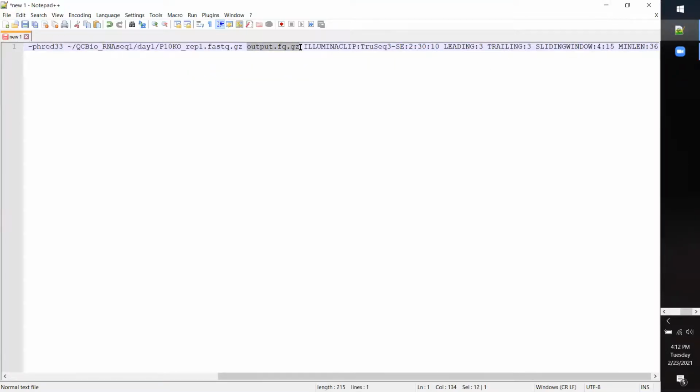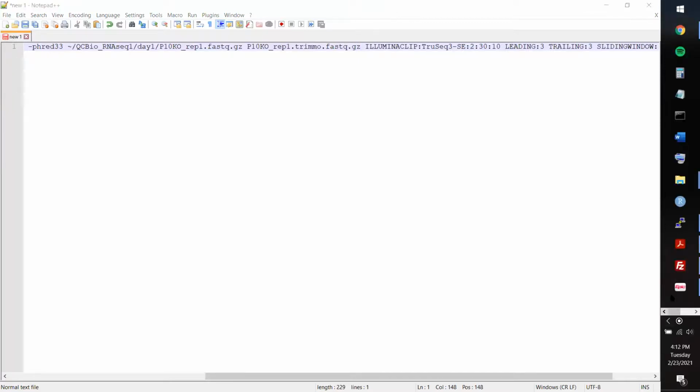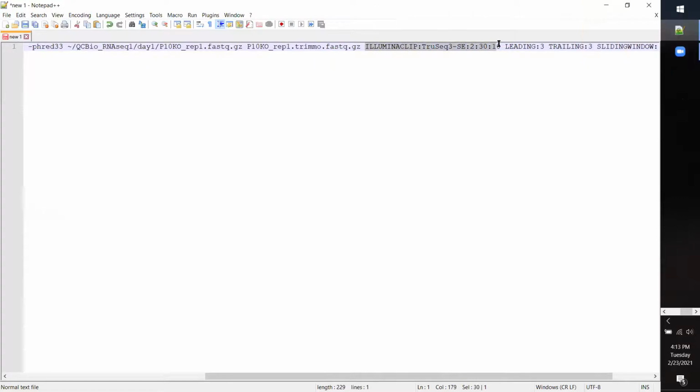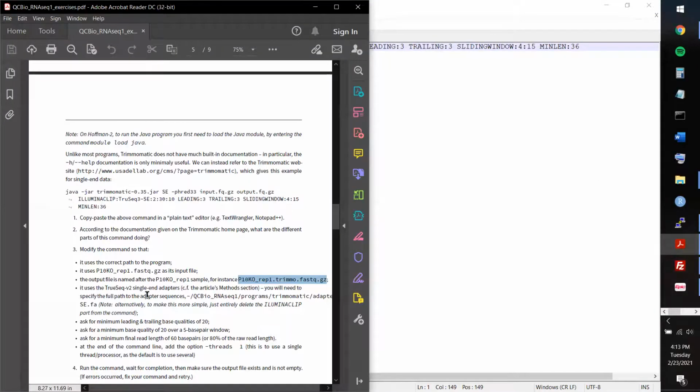So I replaced the default with that output name. The next step, I didn't really fully understand what you meant here, so I just ended up deleting the Illumina clip part. So I just get rid of that single command. And then I filled in the numerical values that you recommended. So for minimum leading and trailing qualities of 20, I changed this to 20 and that to 20.